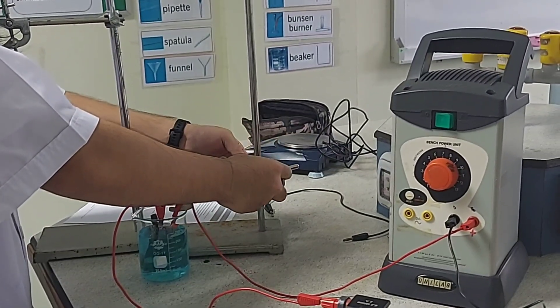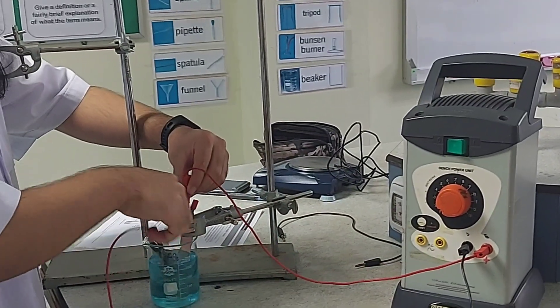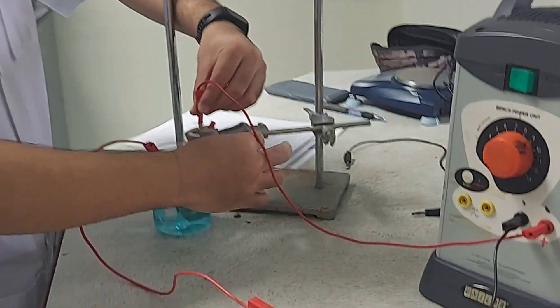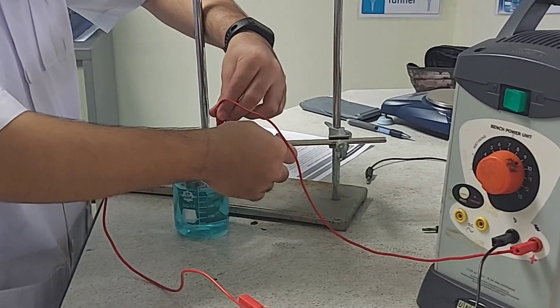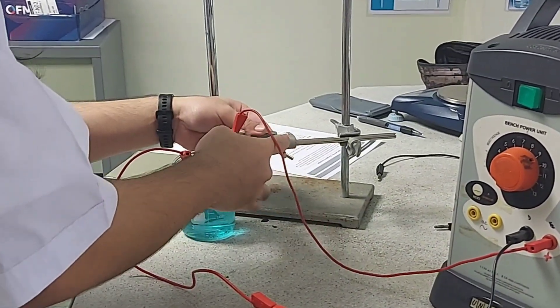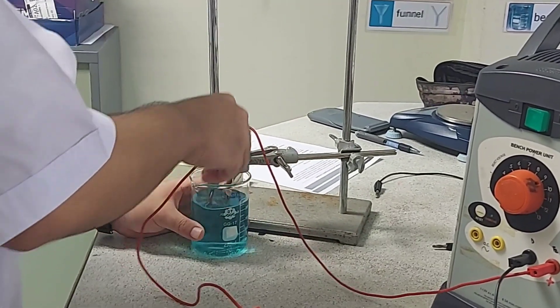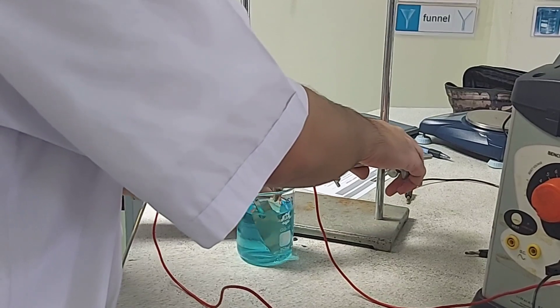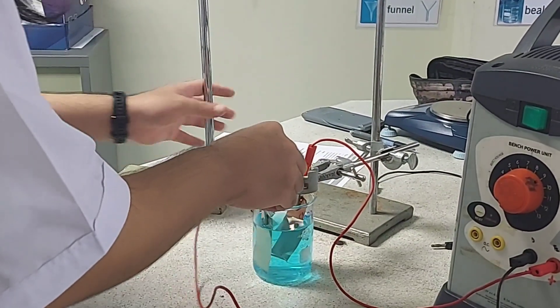Once the electrodes are dipping into the electrolyte and adjusted on the clamp stand, switch on the power pack and note the exact time. Adjust the variable resistor so that a current of 0.2 amperes is flowing, and keep the current at this value throughout the experiment. After 40 minutes, switch off the current and note the exact time. Remove the anode and rinse it carefully, first with pure water and then with ethanol, allow it to dry in the air, and then re-weigh it accurately.